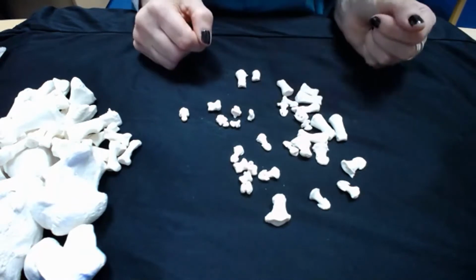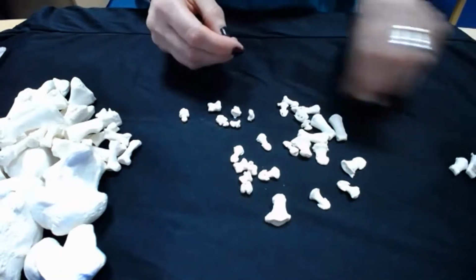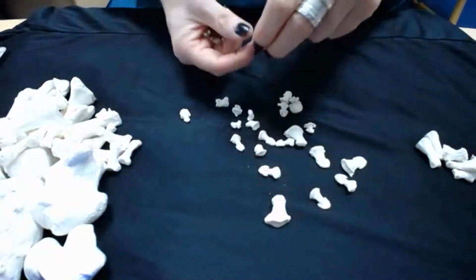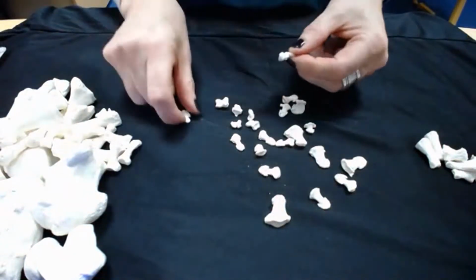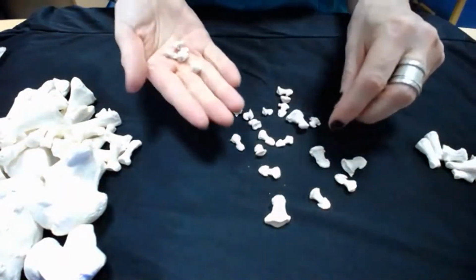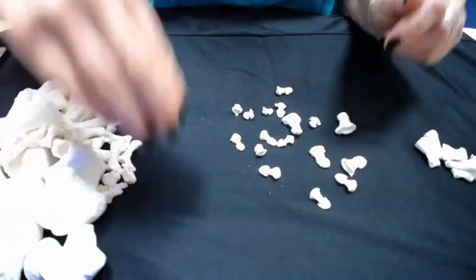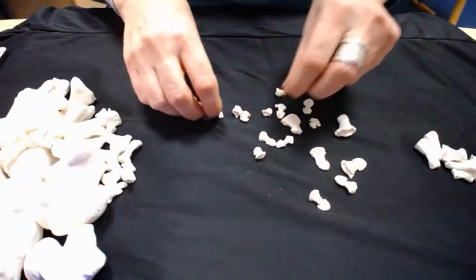So you can tell the difference between the two, obviously. So I'm going to separate these out now on my hands. And then these little ones for my foot. Sometimes they're fused to the distal phalanx, this little arrow-shaped head. And that's in life, they can often be fused together like that. It's a normal variation. So I'm left with the distal phalanges now, these arrow-shaped heads.